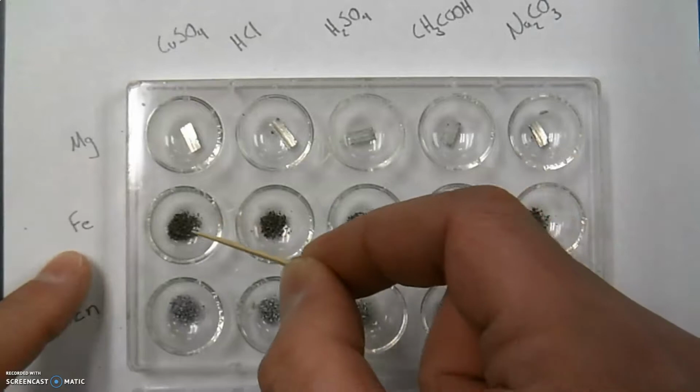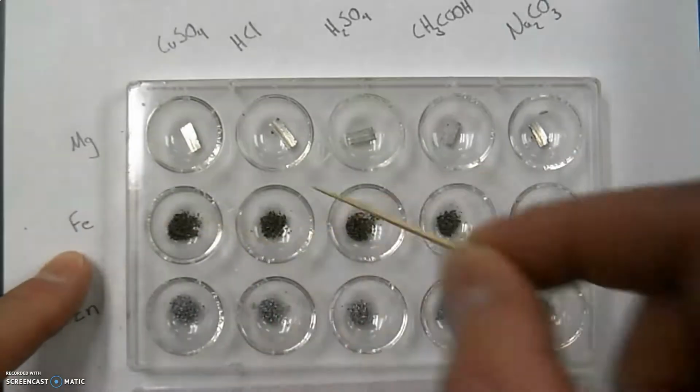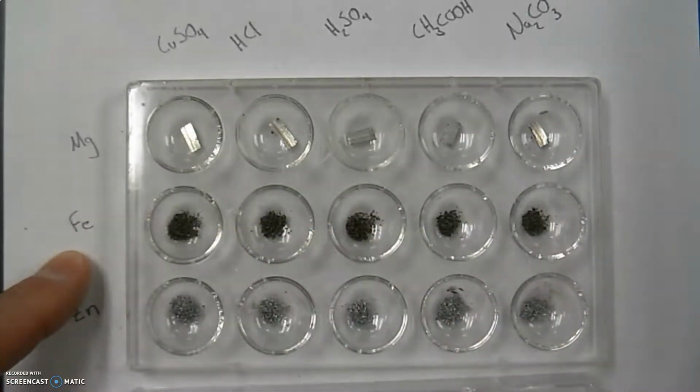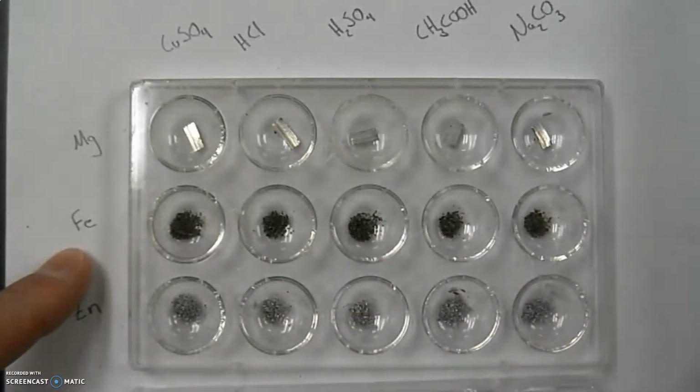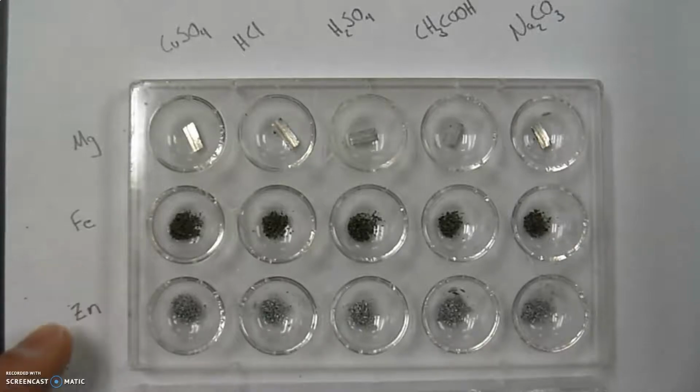And then I would do the same with the iron, and for the iron I actually use a powdered, pulverized version, so it has more surface area and you can see the reaction more effectively. I did the same with the zinc, and then the calcium carbonate. Calcium carbonate would be like marble chips, but again, this is pulverized, so it's just a powdered form of it, and then I'd run these against each other.